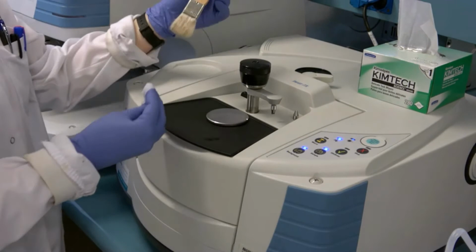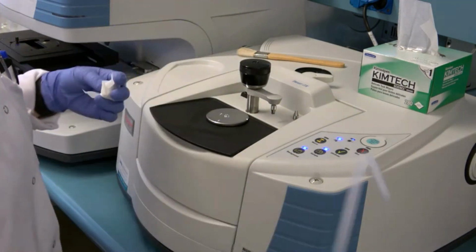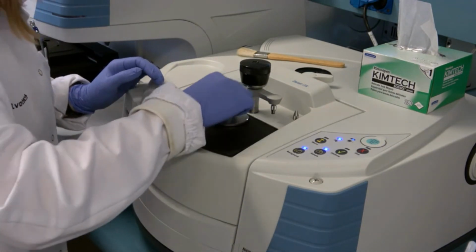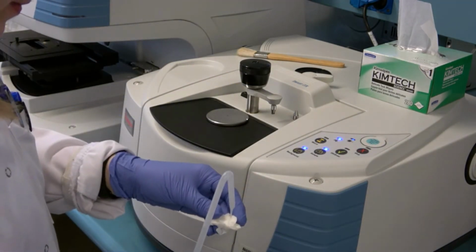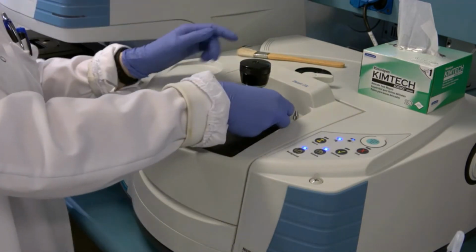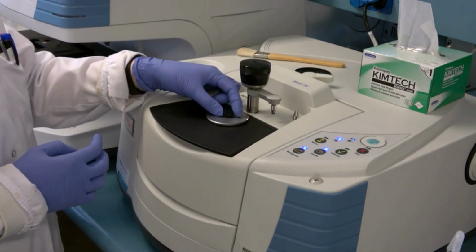with the tissues. The tissues provided are softer than regular paper towels and decrease the chances of the sample holder getting scratched or damaged. Both the plate and the pressure pin must be cleaned as the arm comes into contact with the compound as well. When clean, the black disc is placed above the sample holder in the plate and the pressure pin lowered down again.